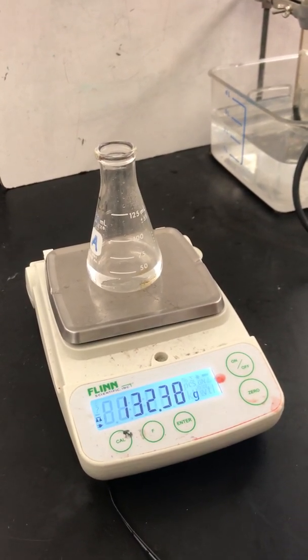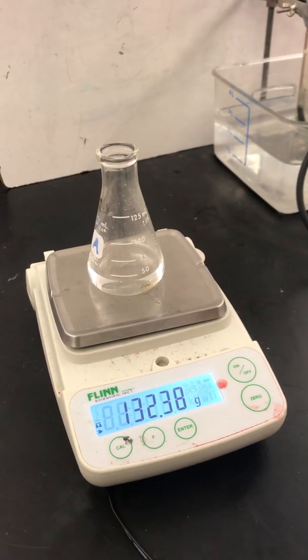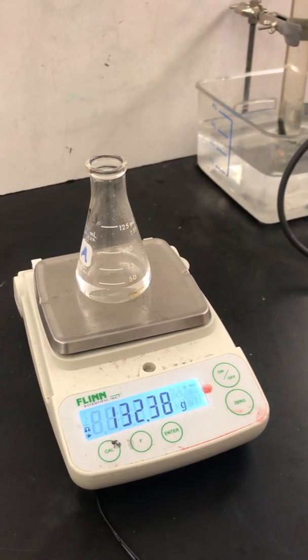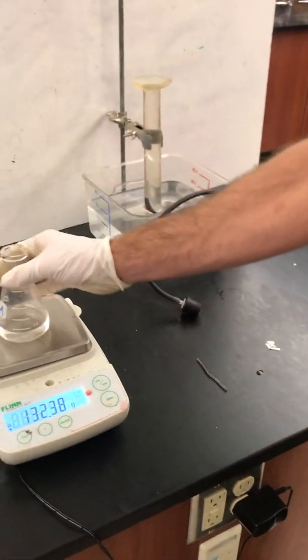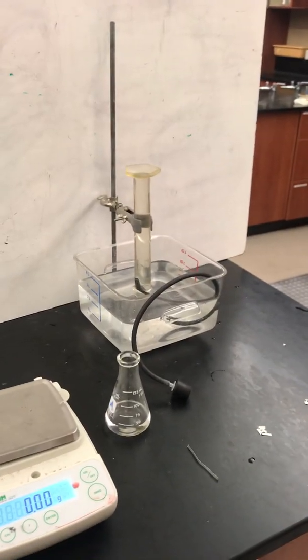So you hit start when the magnesium goes in, and as the reaction's occurring with the gas being produced, you're going to see a change in mass. After the elapsed time, you hit stop, record the final mass, and the difference in those two masses would be the change in mass. The second option is to monitor the volume of gas produced over time.